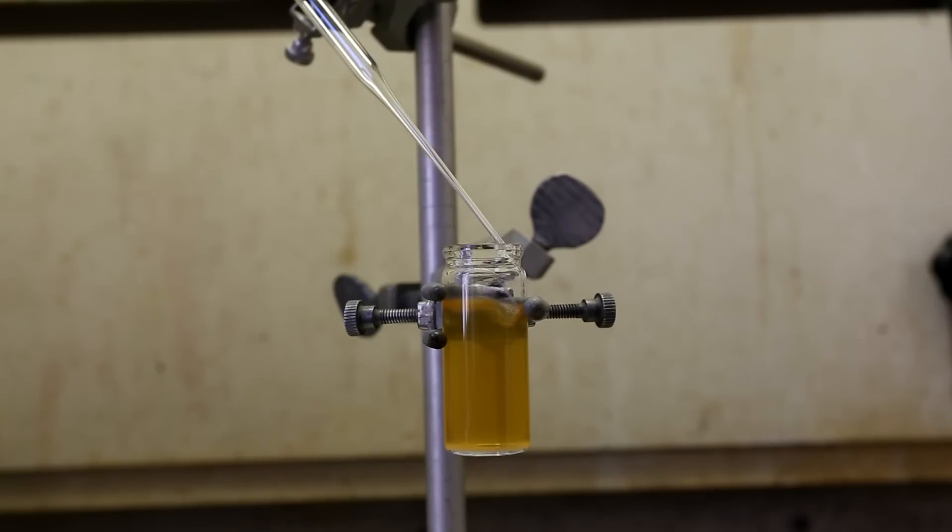Then under a small jet stream of air I evaporated the ethanol. The white particulate in the solution is mainly sodium bicarbonate, salt, and lysine.